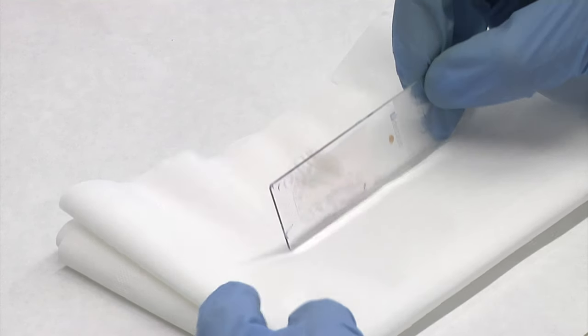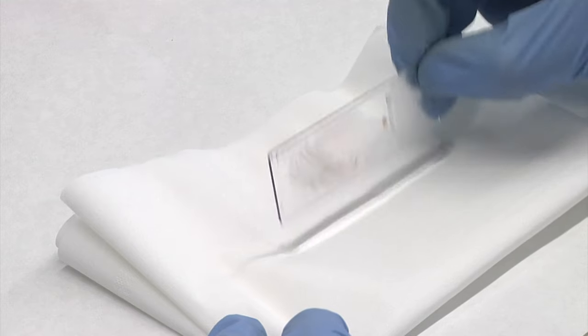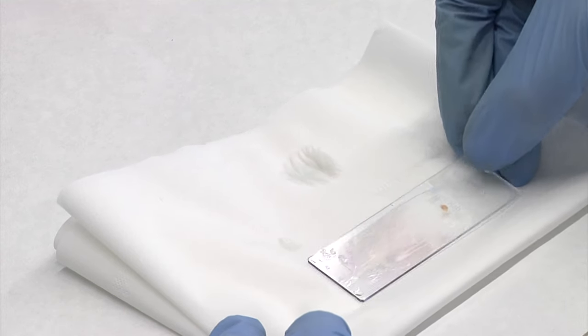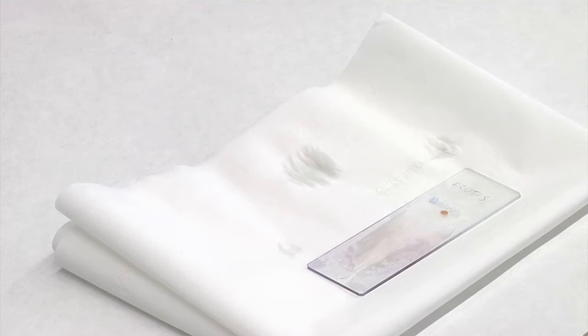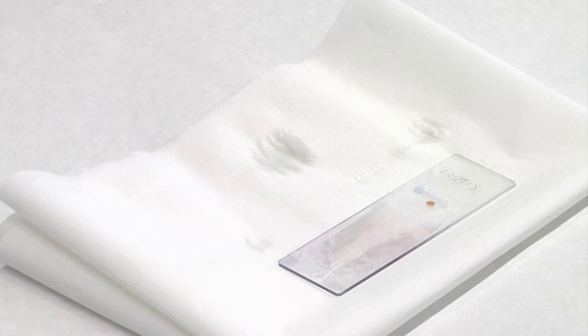We let the sample dry in the air for a few minutes and then we have the sample ready for its observation under a microscope. If we want the sample to be kept long term, we will use an adhesive solution and a coverslip to protect it.